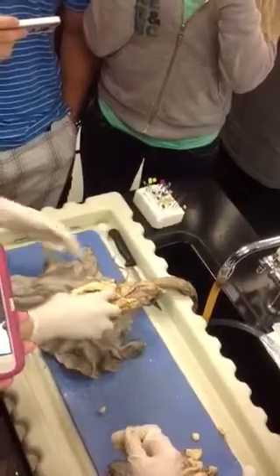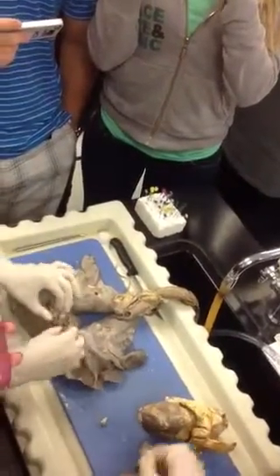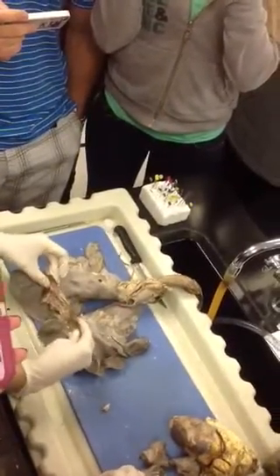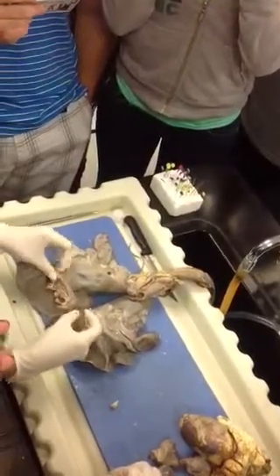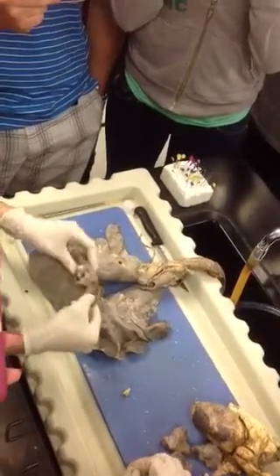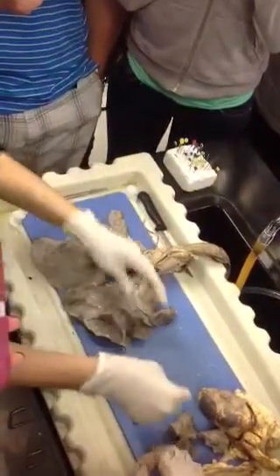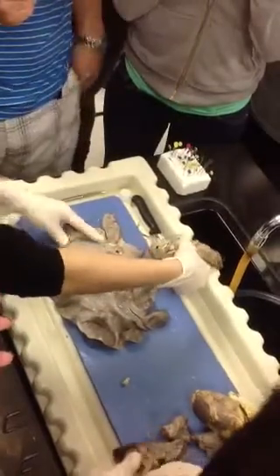All right? So they cut away the heart, which has a lot of fat surrounding it. And then here at the very bottom, this used to stretch out and help with inspiration, expiration. What is this? Diaphragm. The diaphragm, good. So the diaphragm looks like well-done steak, I always say. And we'll remove that to be able to identify diaphragm. And then they removed the trachea.